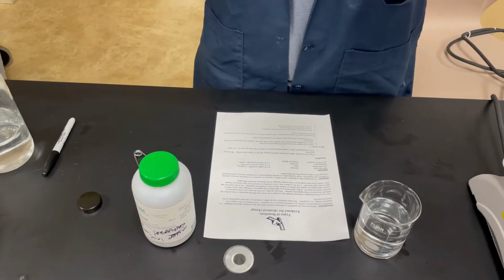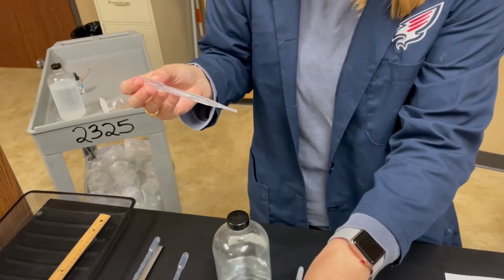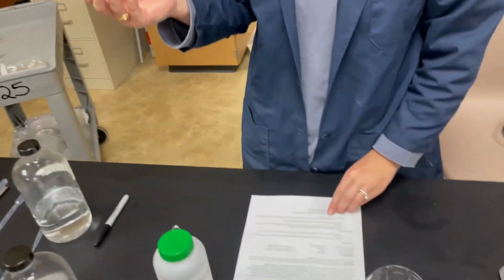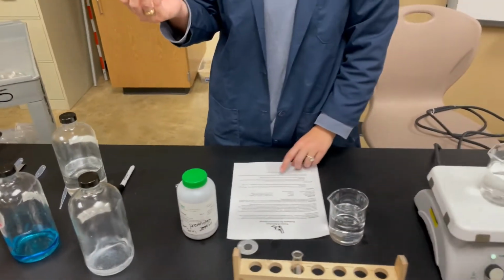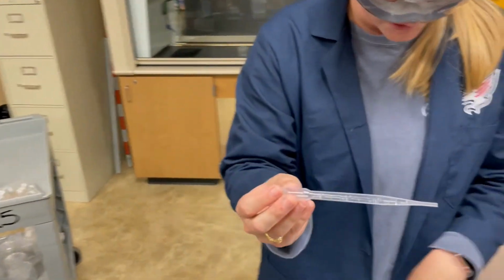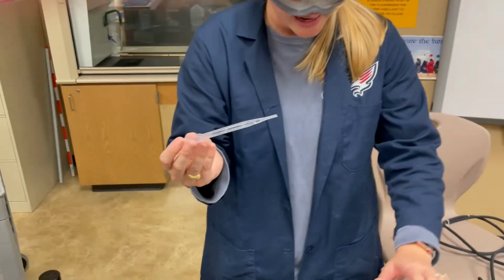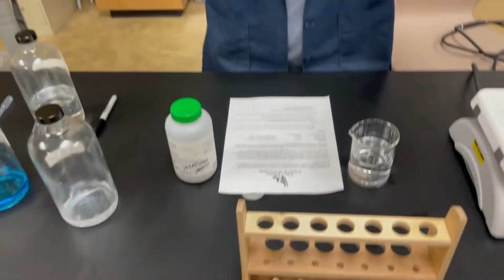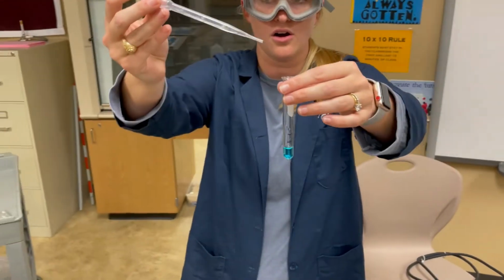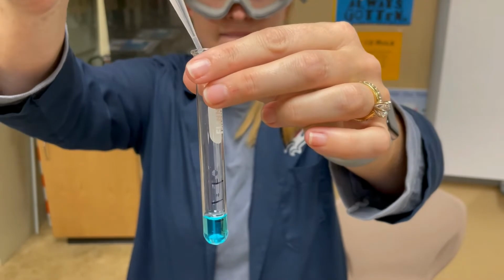And this is my reaction here. So if you're looking at the reactions that you did in the pre-lab and on your lab sheet, it says we've got aqueous copper 2 nitrate and aqueous sodium hydroxide. Remember, aqueous means they are dissolved in water. And we're going to react to form a solid copper 2 hydroxide and aqueous sodium nitrate. So let's see how this goes. Get real close so you can see it. Ready?